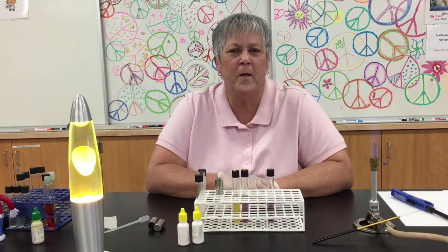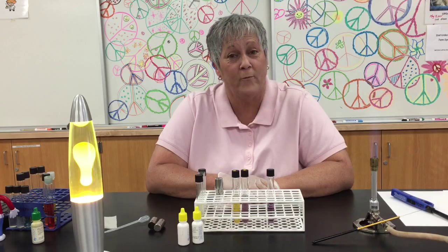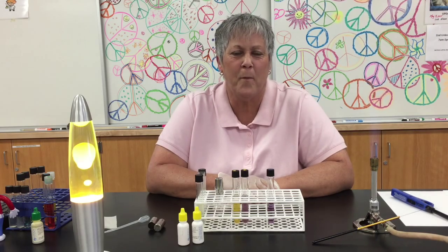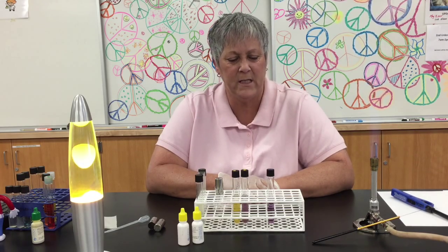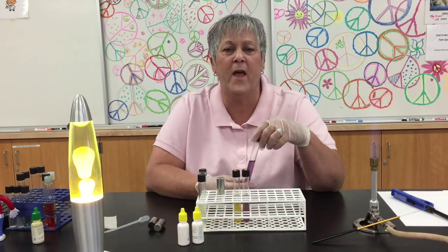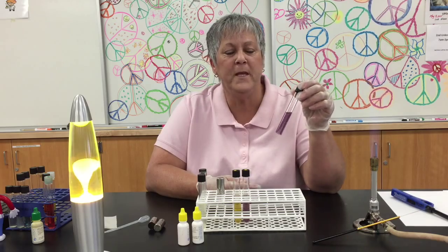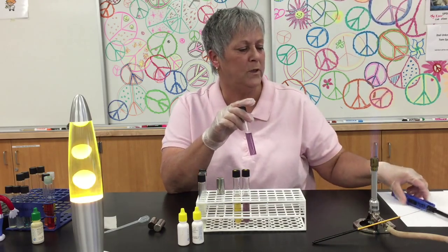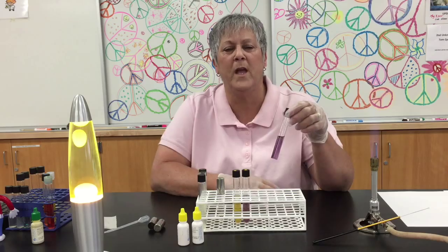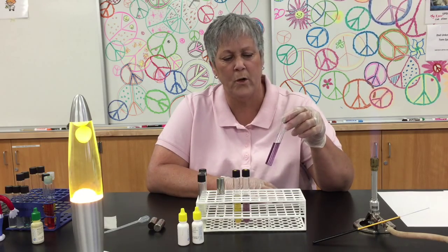Hi students, welcome to One Minute Micro Techniques with Lisa Schimmel from Crafton Hills College. Today I'd like to talk about the decarboxylation of amino acids test. We've got three different varieties of that media — it's a broth, and the pH indicator in it is bromocresol purple. The three amino acids that we have available are arginine, lysine, and ornithine.